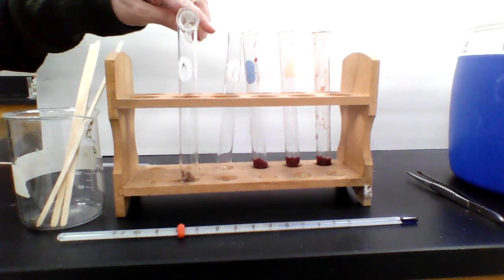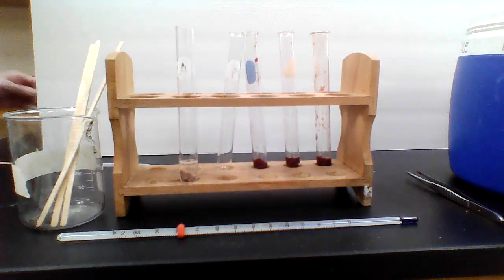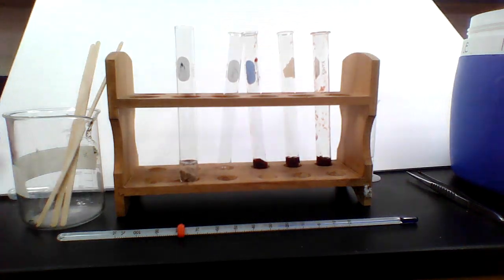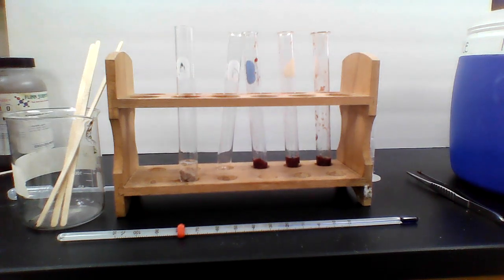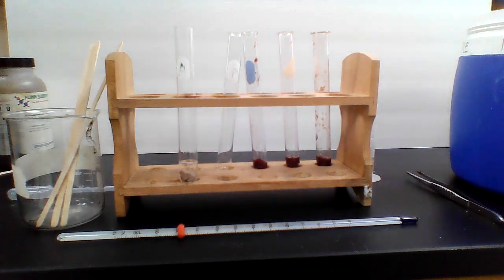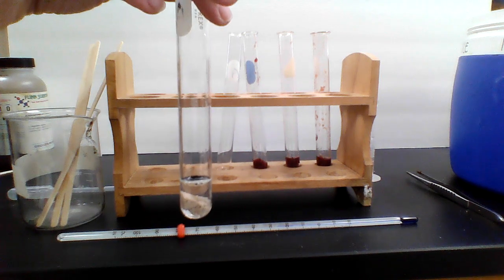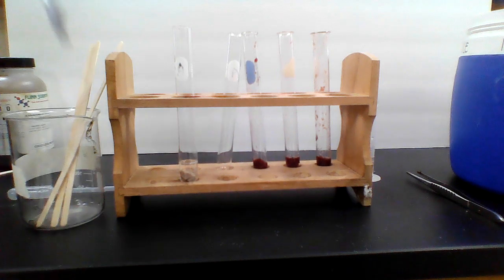So this would be like if you had a super, super high fever, over 108-degree fever. This is what happens. Whoa, Nelly. This is what would happen if you had over 108-degree fever. Your enzymes denature, which basically means your enzymes melt. They change shape. And if you can tell, there's no bubbling going on here at all. It is completely ruined. So the enzyme is not functioning.